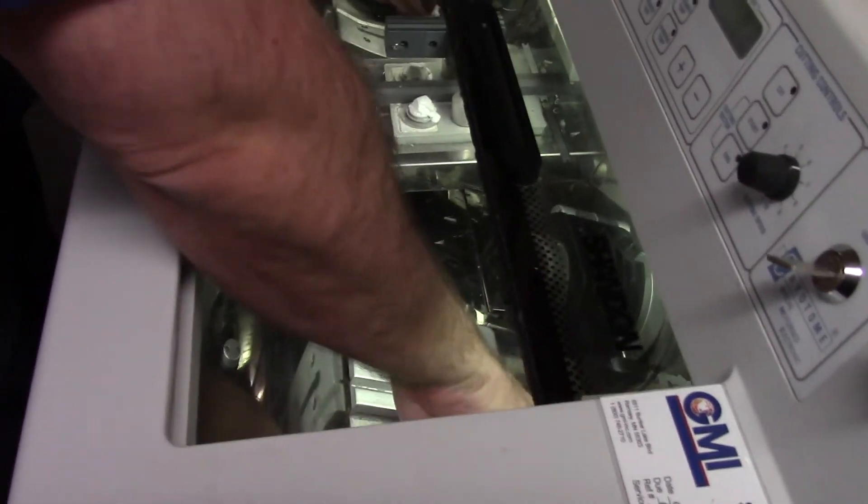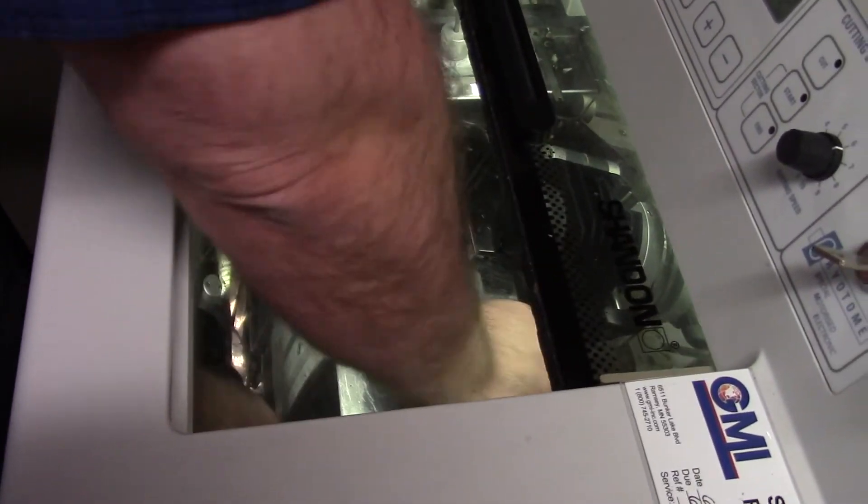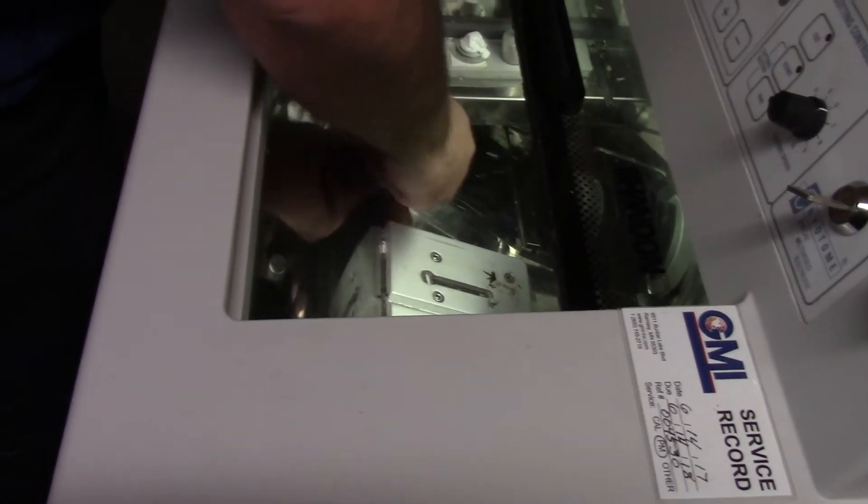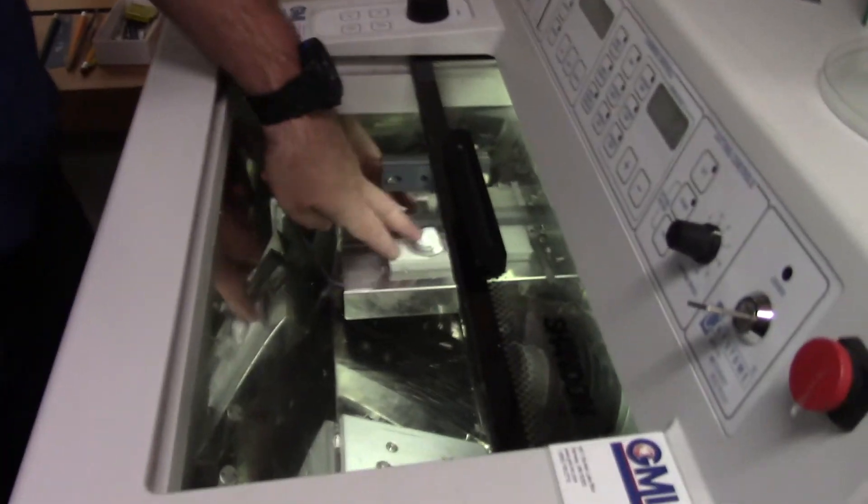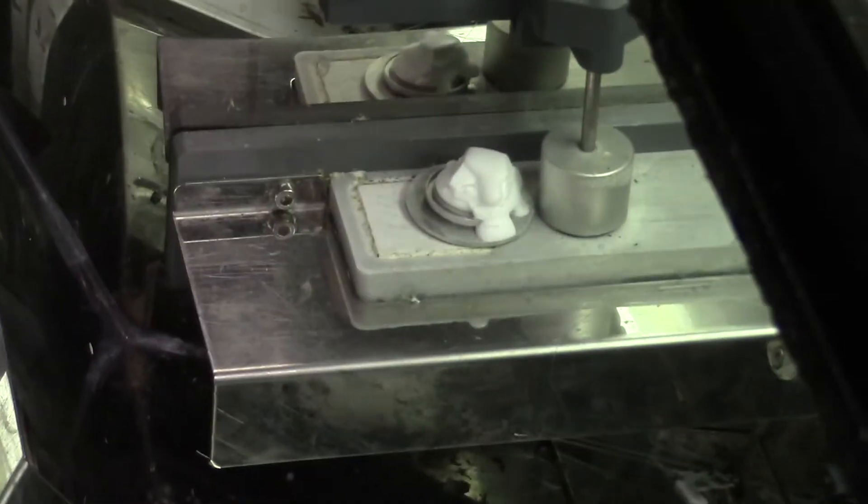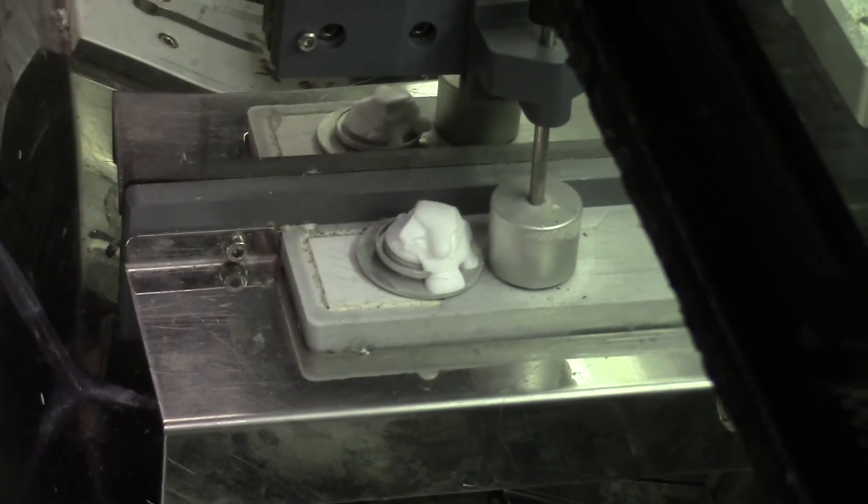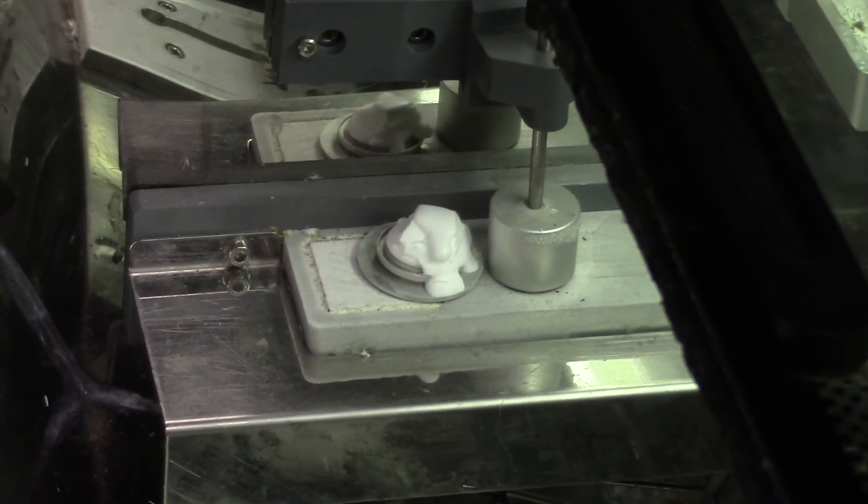So that I don't have dead and decaying tissue just sitting here waiting for the next person to come along and use the cryostat. Notice that while I was doing that cleaning, our tissue has frozen, so I can now take that and put it in a ziploc bag in the freezer.